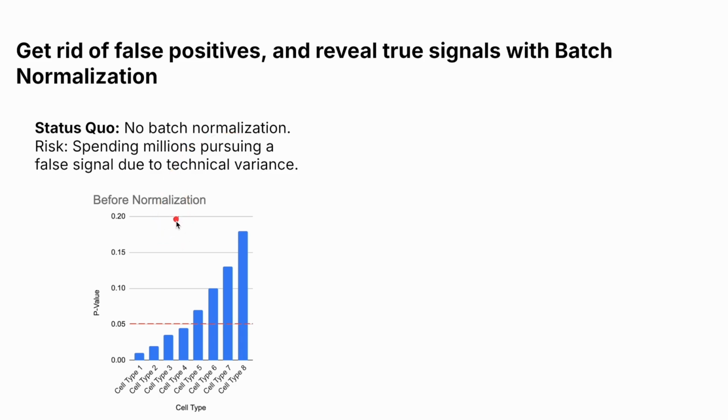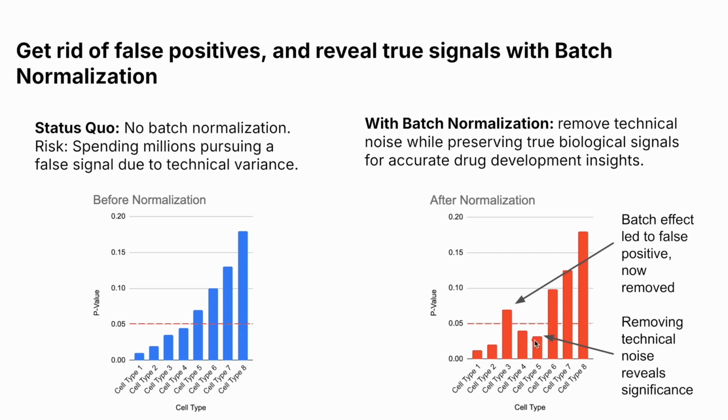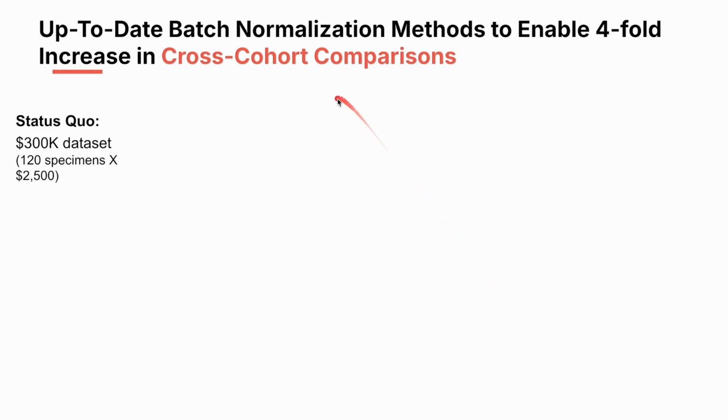What is the goal of batch normalization? It's to get rid of false positives, false signal in your data set, and reveal true signals. On the left-hand side here, you have the status quo before normalization. In the x-axis, you have a bunch of different cell types over here. The y-axis, you have the p-values, and the number over here is 0.05. You can see here a bunch of things look like significant results, and these guys do not look significant. Then, applying techniques like batch normalization, you might be able to find out that some actual cell types you thought were significant are now removed owing to the technique, and others are revealed as truly significant. So this is really exciting to see this potential to find true signals in your data set that might be missed otherwise.